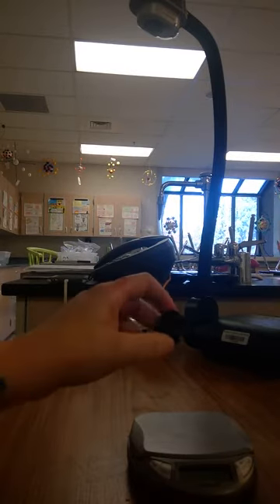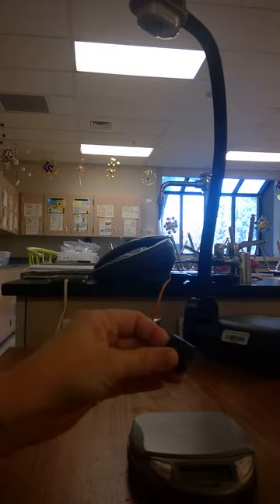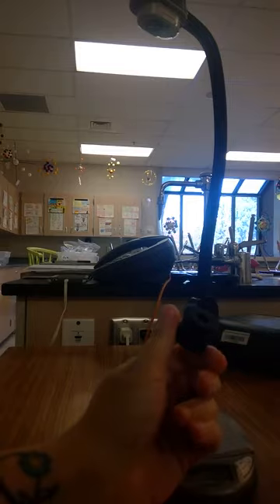So I'm going to start with the black circular ring. It's a nylon spacer. And so I've already zeroed it out. And it is 6.6 grams. So now that you know the volume of this item and you know its mass, you can use the formula to solve for that.